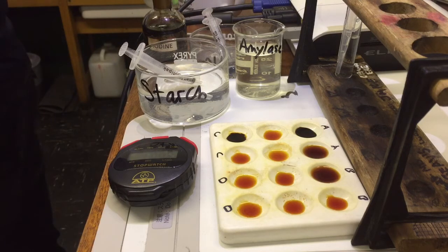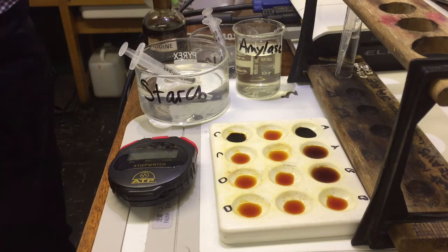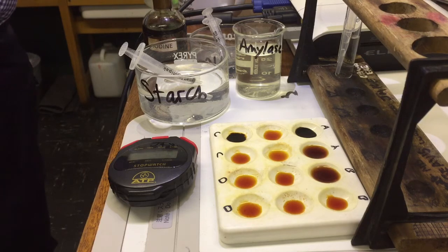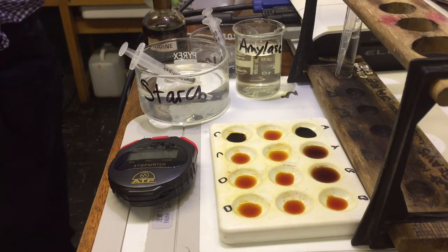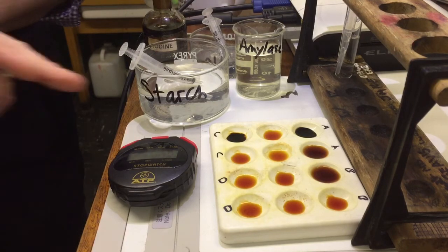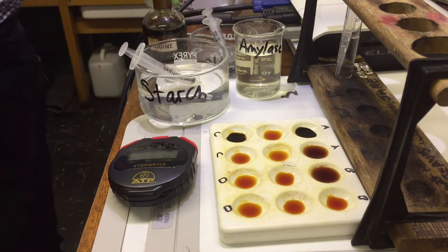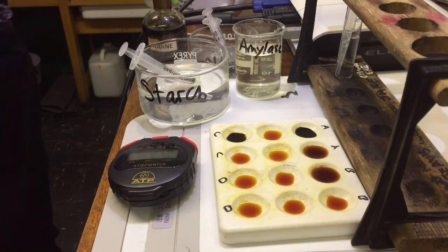That has already reacted inside 30 seconds, so we have to modify the experiment slightly. We can modify it in two ways — to slow down the reaction or make the experiment easier to observe. We could put in more starch so it takes longer to break down, or we could put in less amylase. We could also make the time intervals smaller, doing it every 15 seconds. I'm going to suggest we try doing it with half the amount of amylase and see if that works.